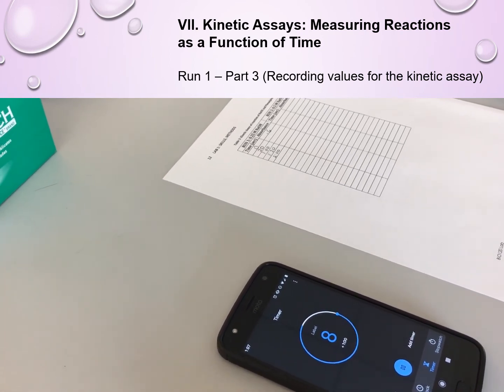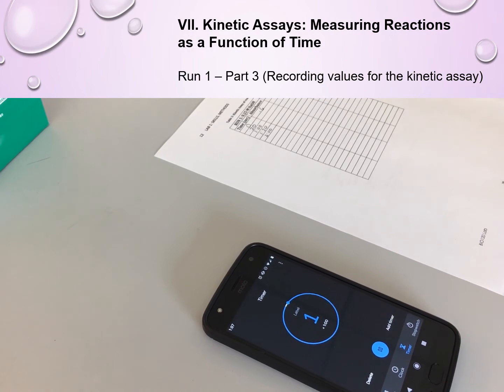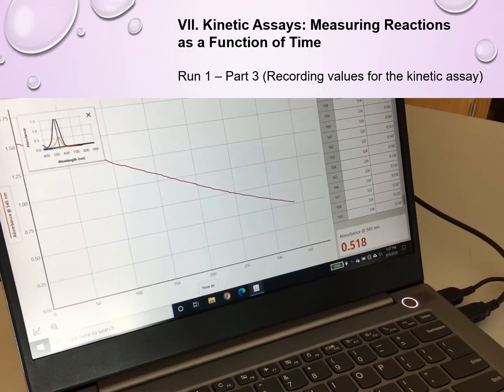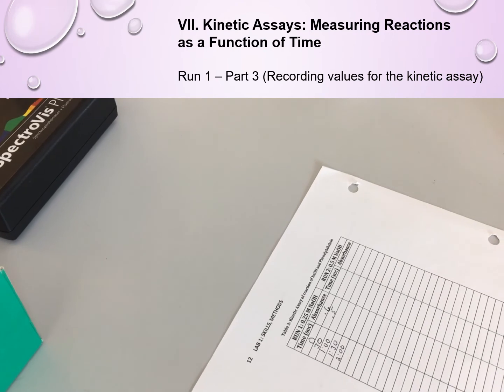So he happened to start a timer for 30 seconds. You could also have the timer going up and just look at the screen every 30 seconds to actually record the value. So you don't need to keep stopping and starting the timer. So the absorbance, when he glanced at it, happened to be 0.5. That was the 30-second time point.